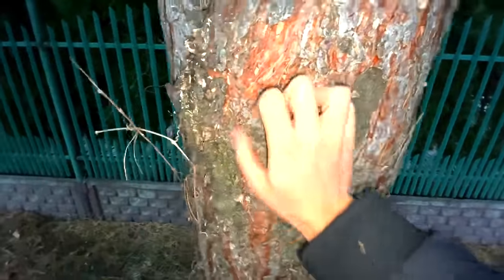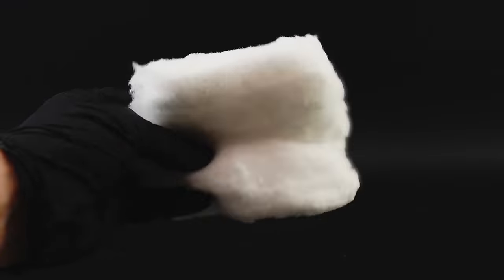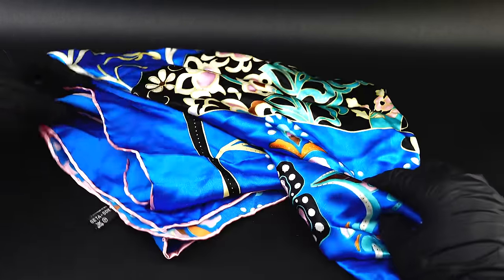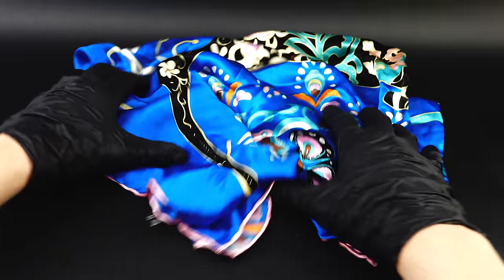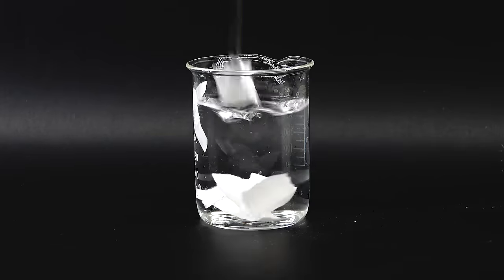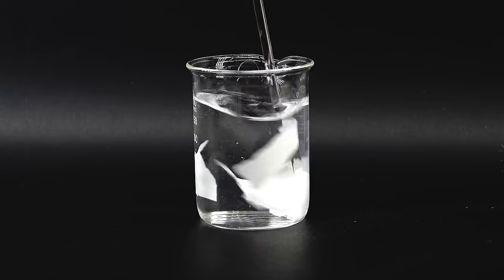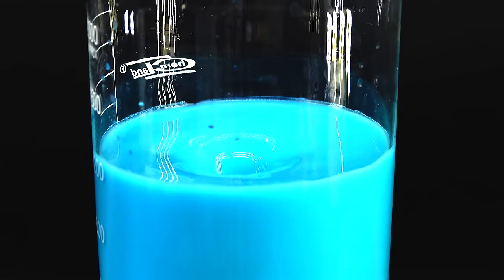When I am done with that, I will have to change the structure of the cellulose, since in its raw form it's more similar to cotton than some designer silky fiber. To do this, I will have to dissolve it in something, which is quite weird to think about, since something like paper, which is pretty much pure cellulose, doesn't really dissolve in anything. Fortunately, chemistry has quite a few tricks up its sleeve, and I will have to create some really funky chemical mixtures in order to make my rayon.